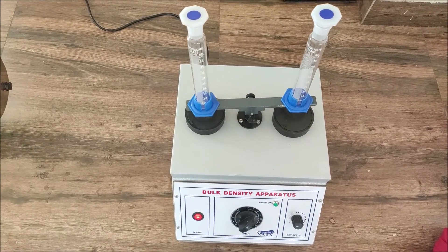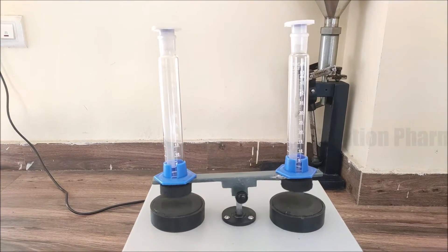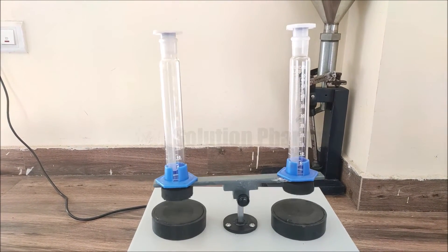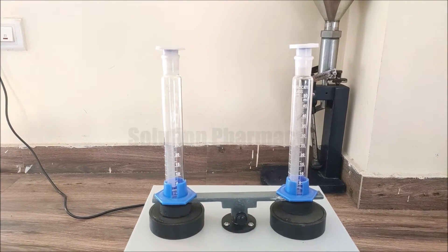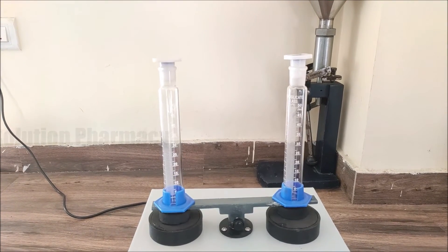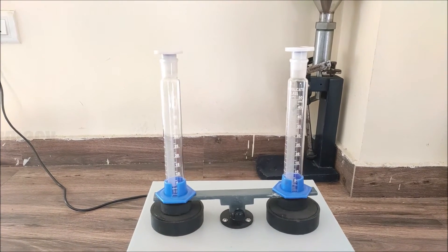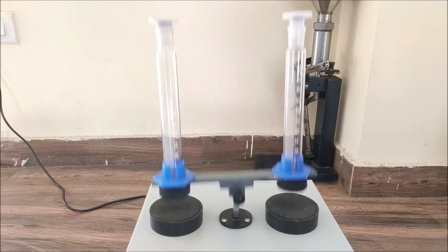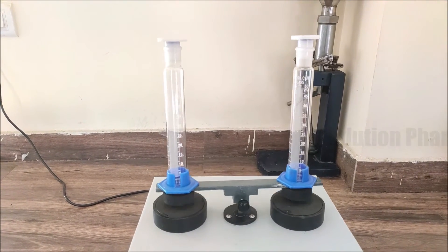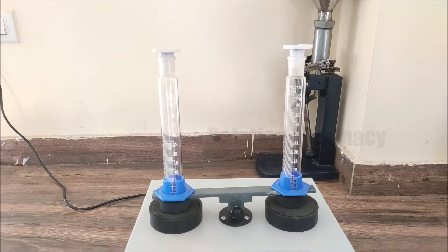Here you can see how the tapping occurs — the shaft lifts the cylinder up to a specific distance and then brings it back down to hit the base. This is how tapping occurs when we have powder inside the measuring cylinder. When we rotate the speed control knob further in the clockwise direction, the speed of tapping increases. We set the appropriate tapping speed using the speed control knob to determine the bulk density.